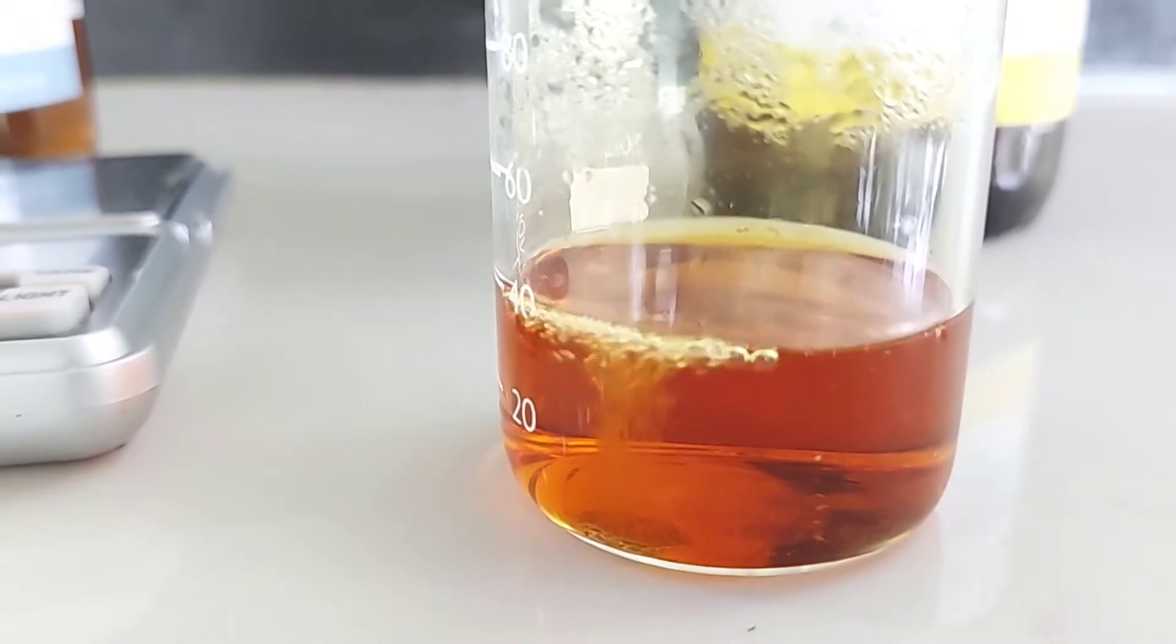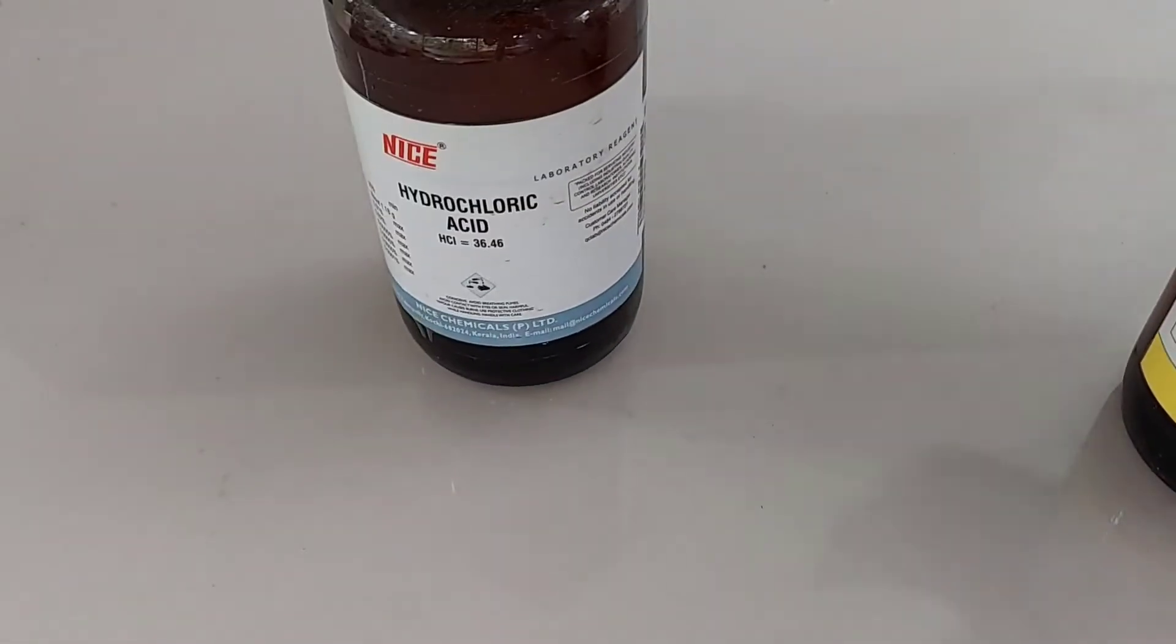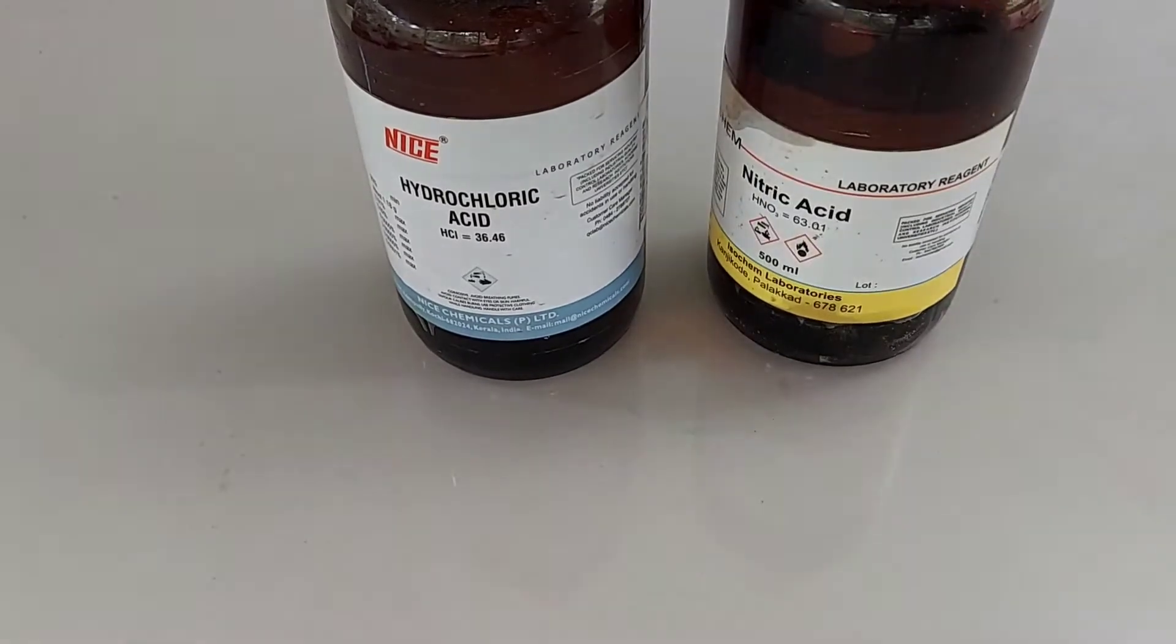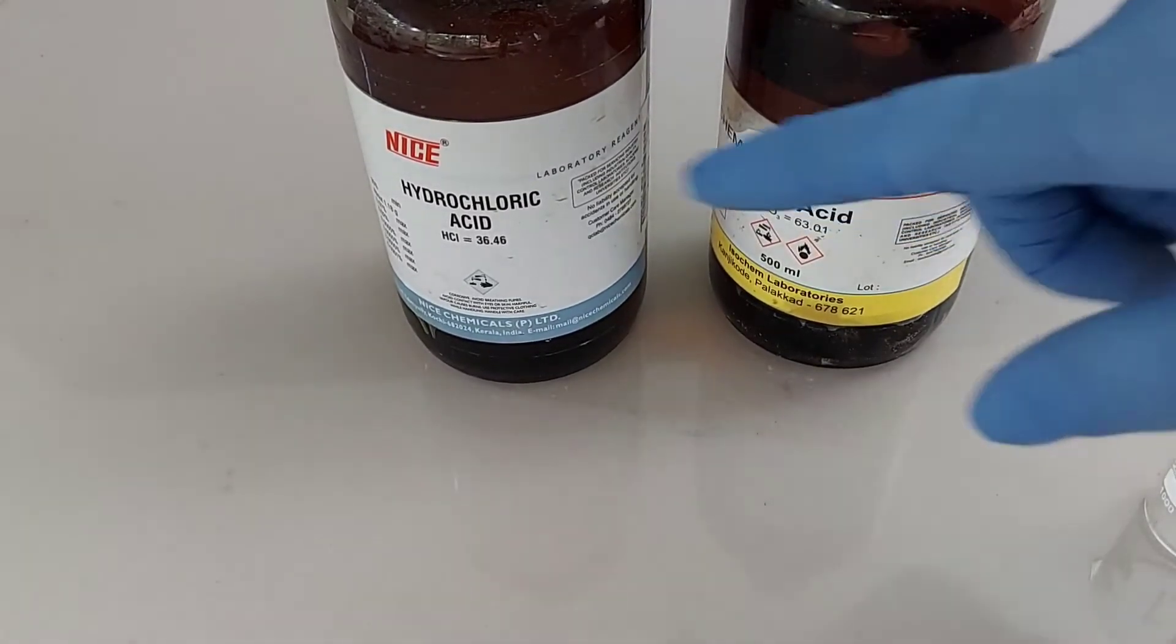Aqua Regia means royal water. This name is perfect for this mixture of two acids since it can dissolve royal metals like gold and platinum.